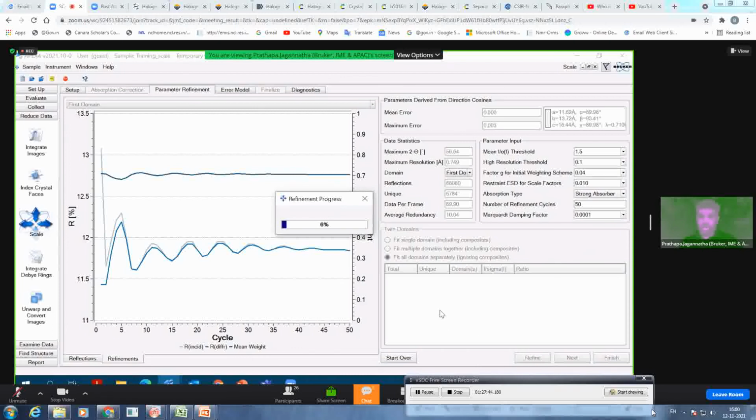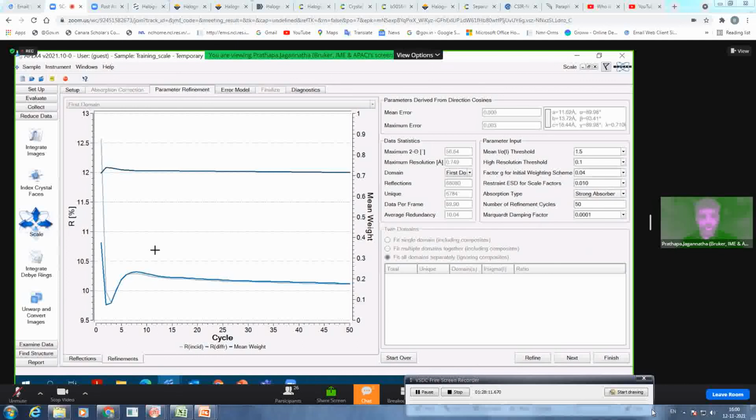Let's see whether I can find any improvement in scaling, or it still goes diverging. Just a few seconds and you will get this update. Whenever you have too much absorption, you might see this kind of behavior, so you need to tweak these parameters. Okay, now you can see after refinement, there was too much disturbance last time. Now you can see only one divergence, but still it is going in a good direction, but not great.